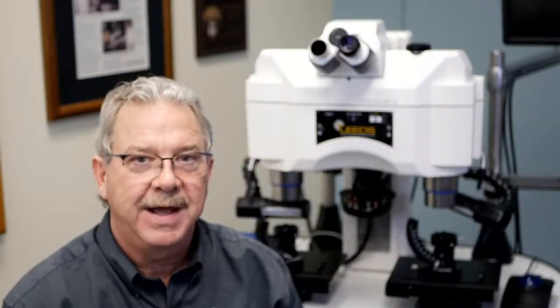If we really take a look at what's changed in eyepieces over the last 50 years or so, number one, the eye point, the eye relief point, the point at how far your eyeball needs to be away from that eyepiece, has grown. The area of acceptance for that has increased. If you were to get enough light to come through the microscope and you held a nice white sheet of paper up in front of that eyepiece, you would actually find the eyepoint by moving that paper back and forth until you had a nice sharp circle of light.